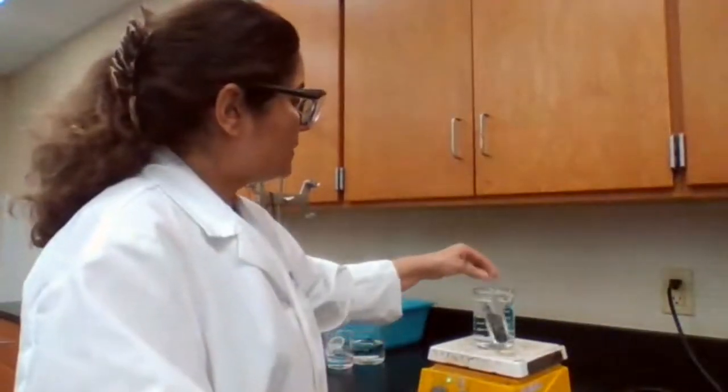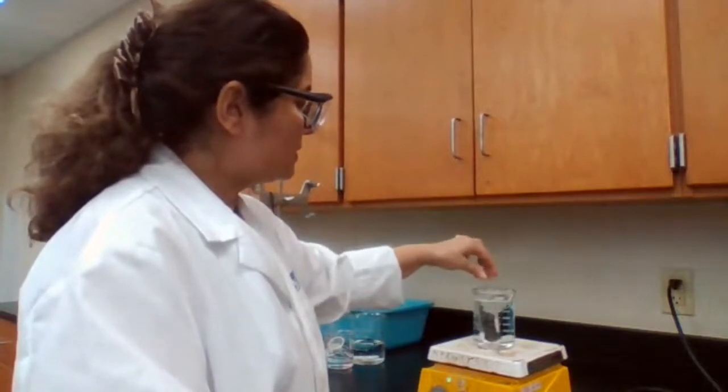I have to give time for the copper to get hot, at least like 5 minutes.